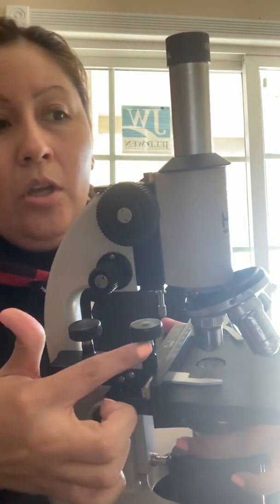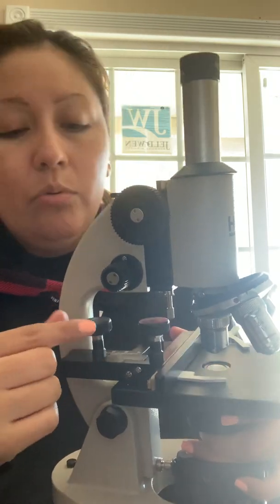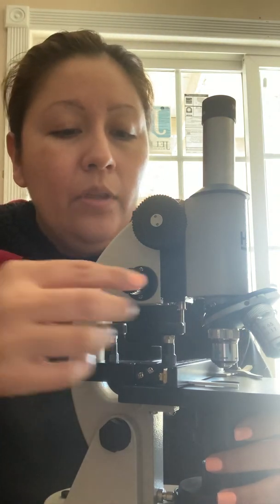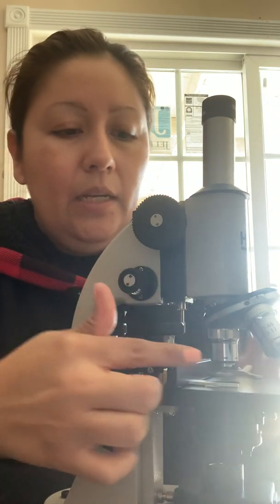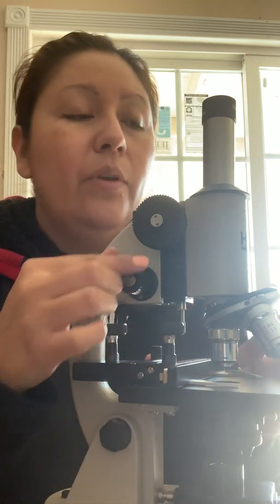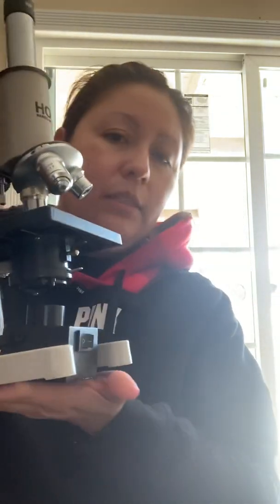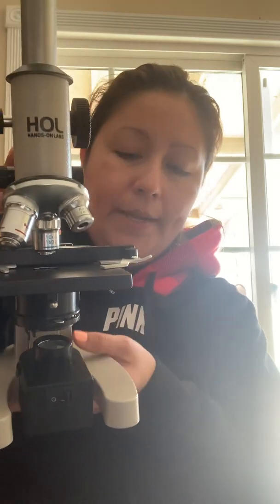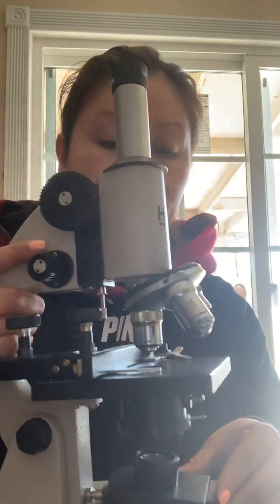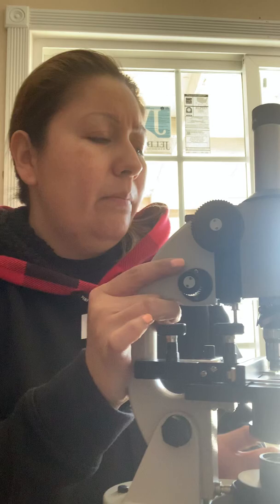are these two. So the transverse and the longitudinal stage control knob, they are used to either move the slide back and forth or from side to side, and it moves, not the stage, but it kind of moves the slide back and forth or up and down. The base is this bottom part, and it's just to kind of support the microscope. I think I went over all of the parts of the microscope.